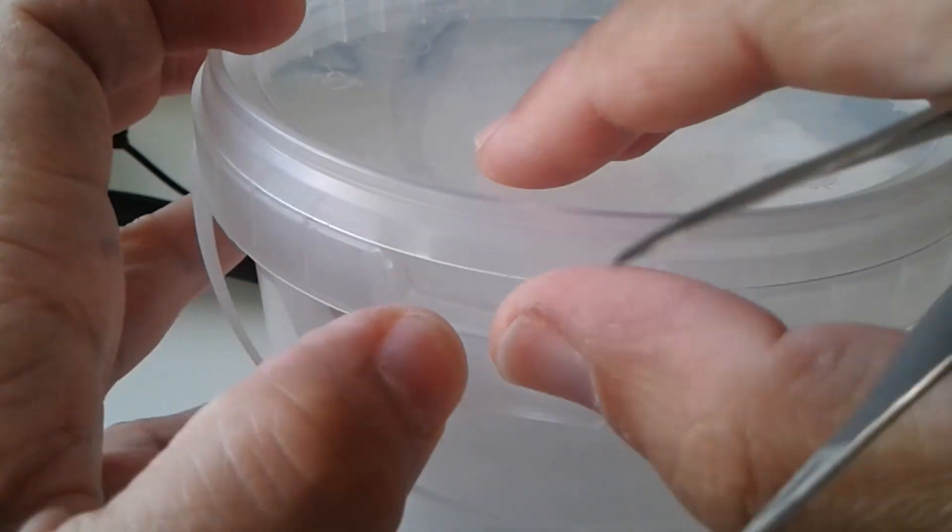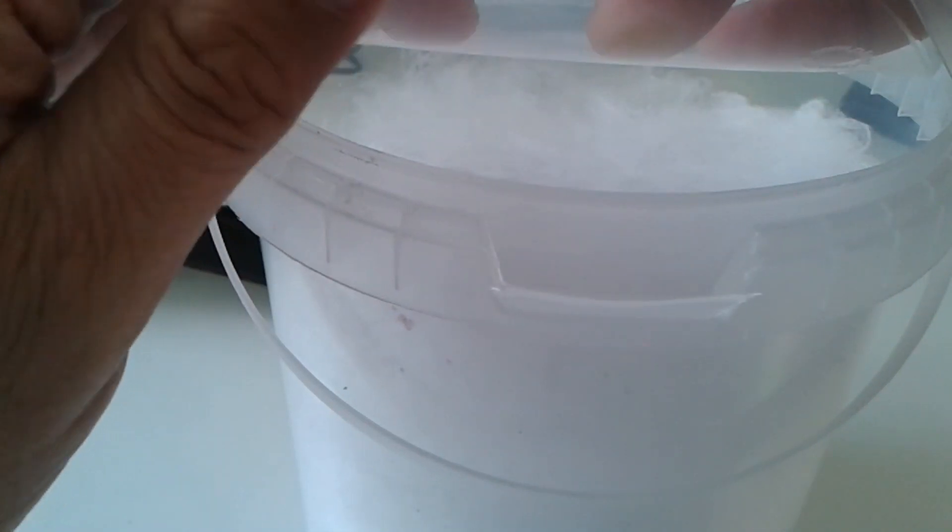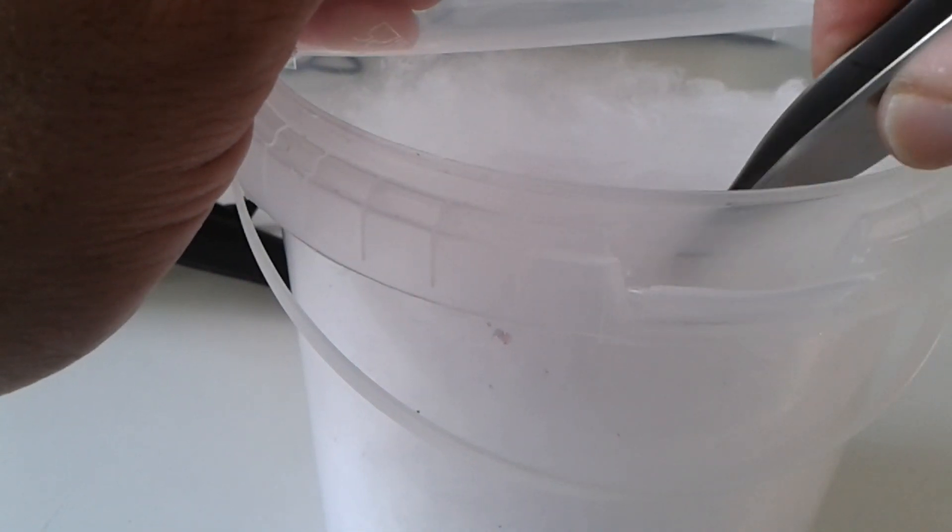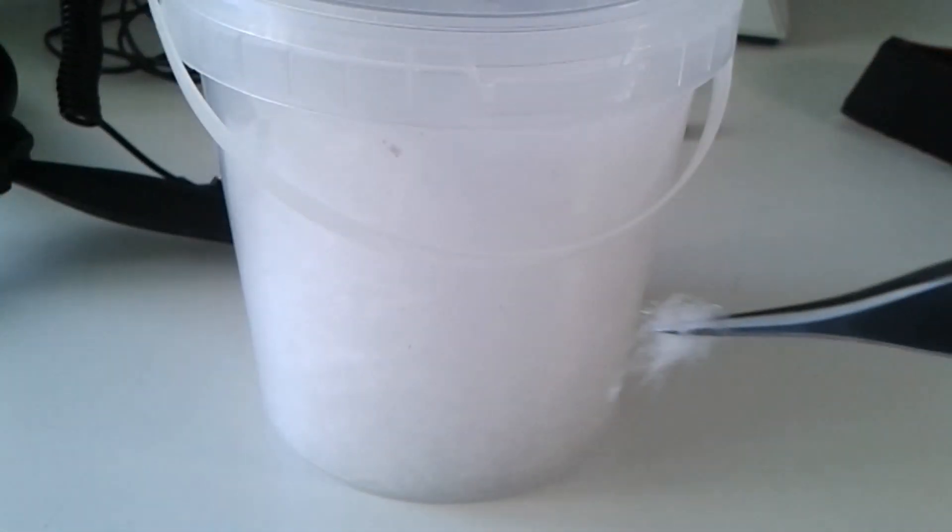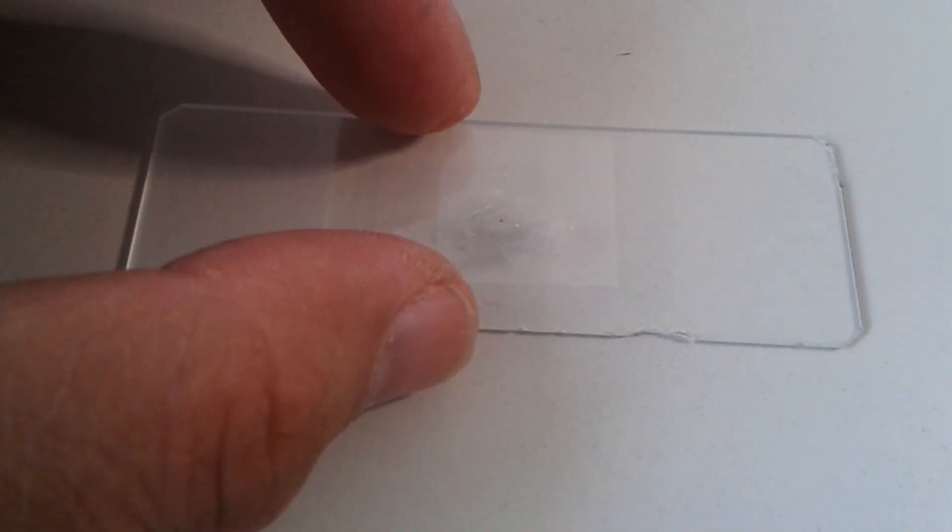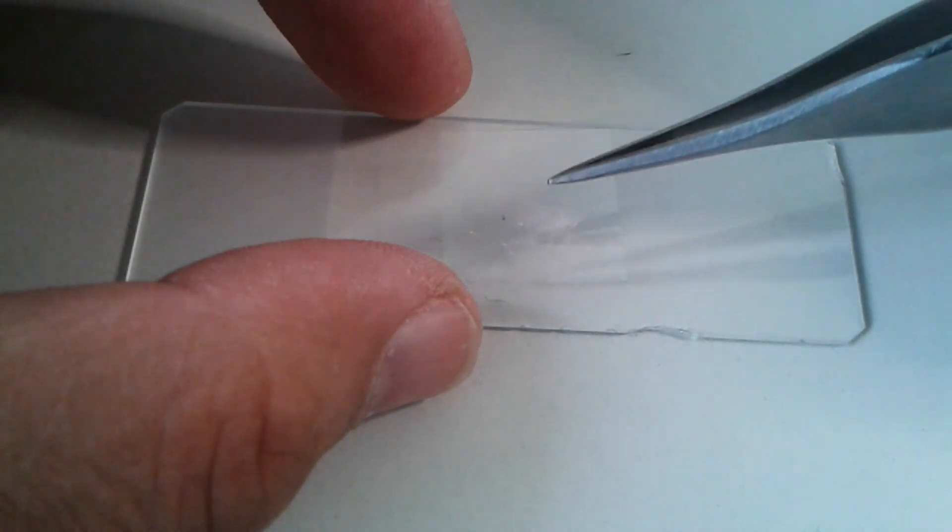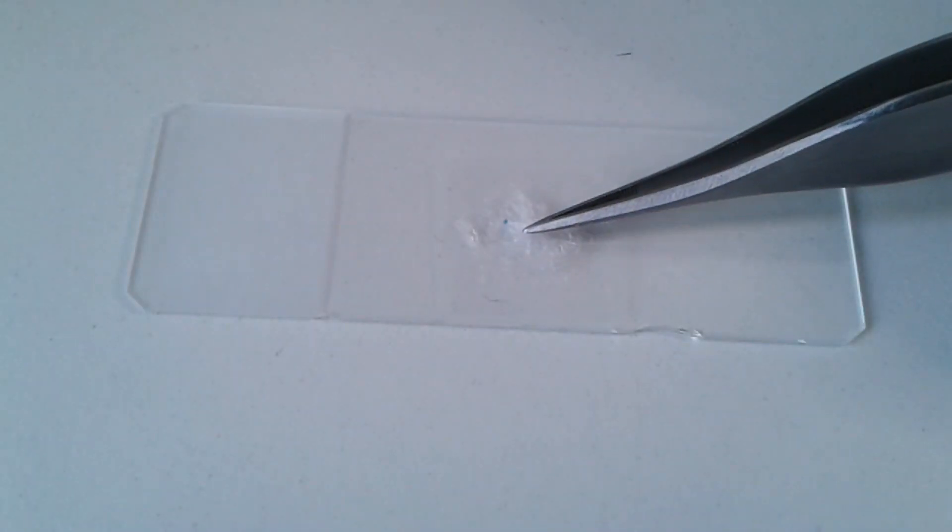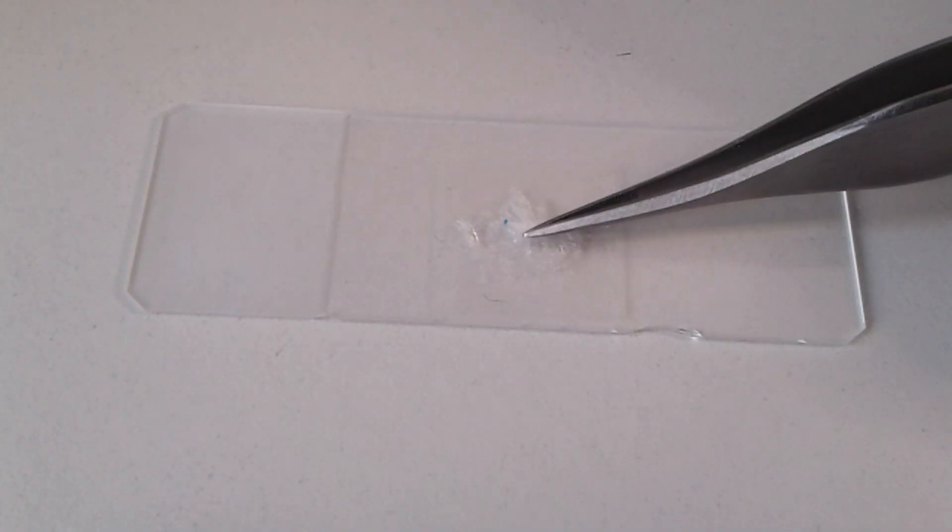I'm simply taking a sample of cotton candy from the bucket. The cotton candy is relatively sticky, so it was possible to directly put the cover glass on top, press it flat, and it stayed flat. Obviously I'm not using any mounting medium because any type of moisture or water would have immediately dissolved it.